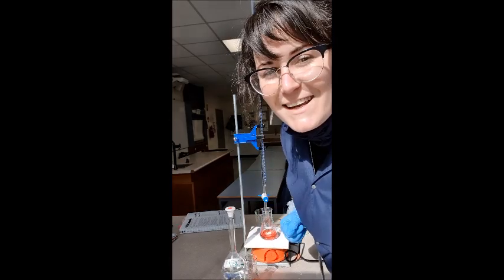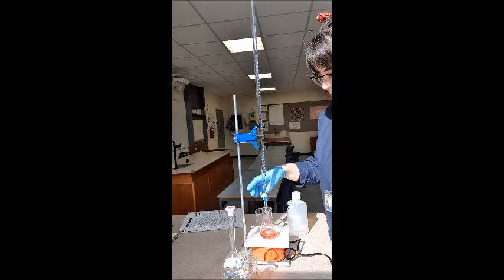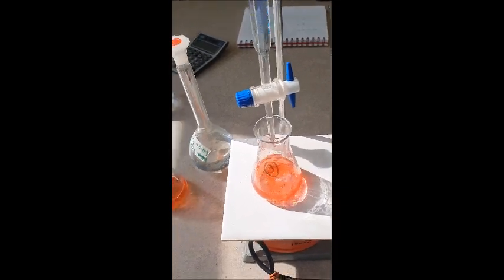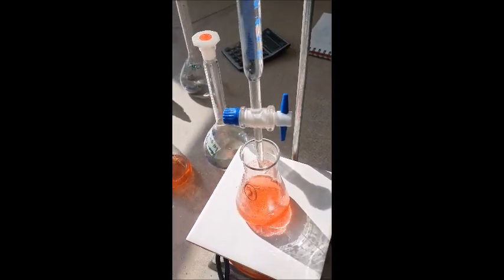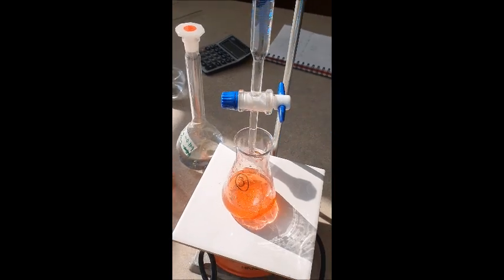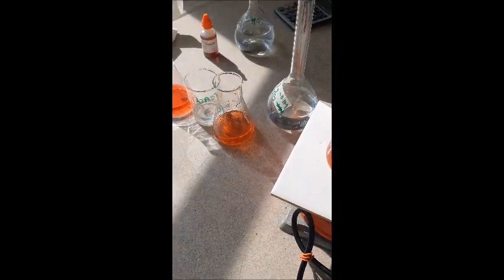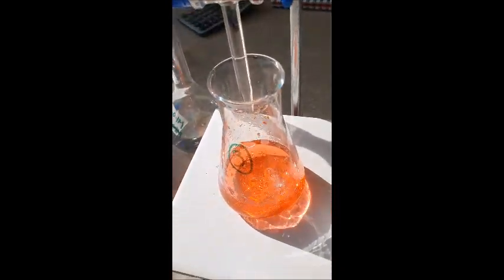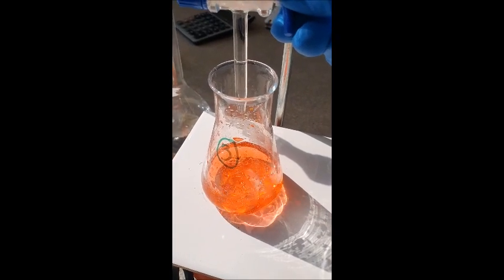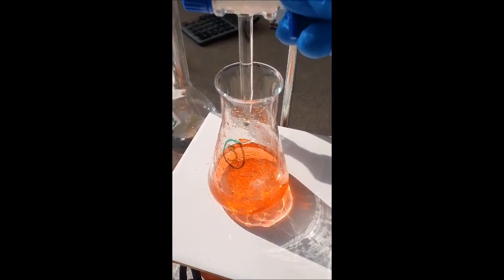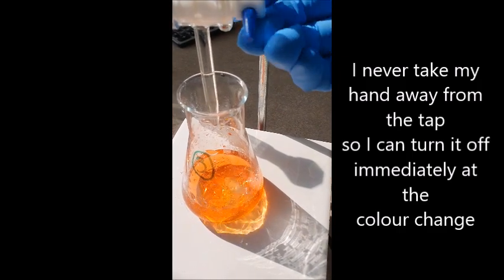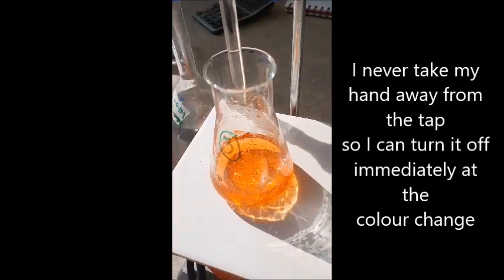Number three. Do you think we're going to get 18.5 again? And it's off. I'm going to stop it at 18 this time and then we'll let it do drip wise. It's at 18. Can you see that's already kind of slightly changed color? Just slightly. All right. So now I'm going to just turn this only a tiny bit so we can just get drops. Dripping. I feel like, there it is. There it is. So that has gone orange.